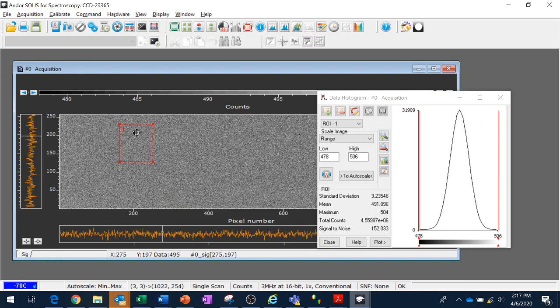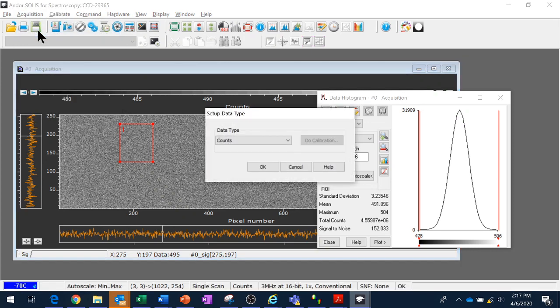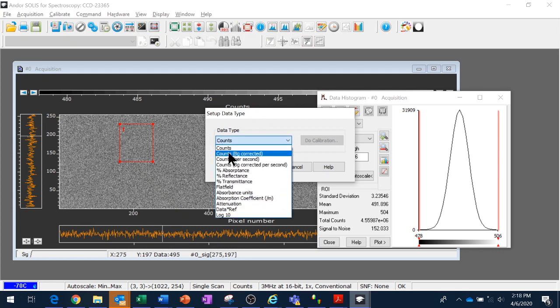So what I can do is switch my data type to one that respects backgrounds. So that is to say, subtracts them. Counts BG corrected here, although I have a couple of options.